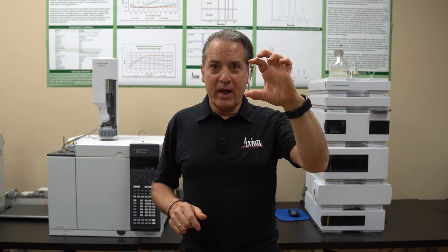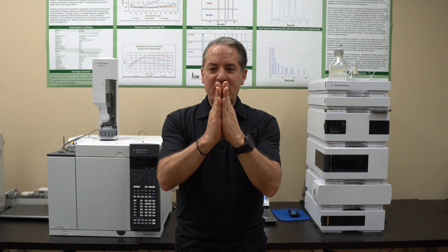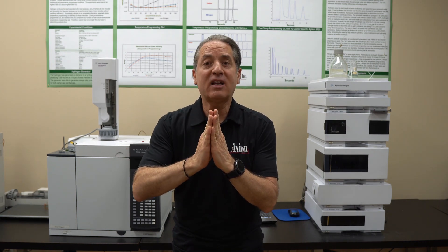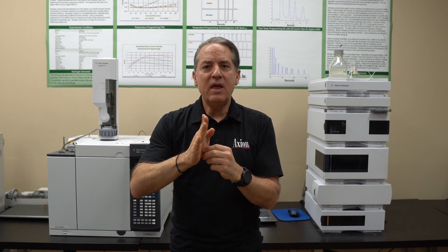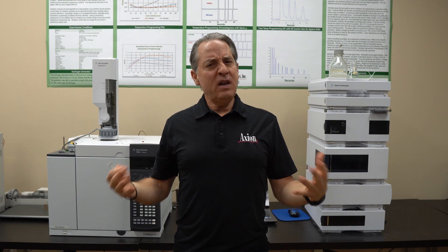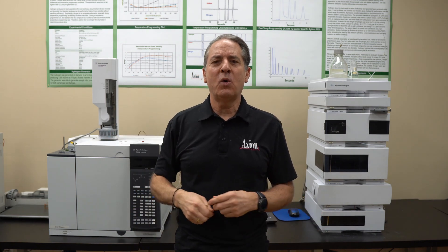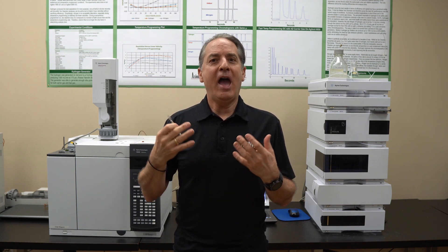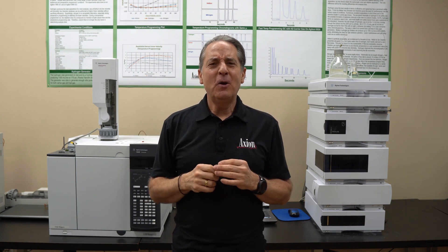The most important question is: how do I know my liner is dirty? We look at the peak shapes — peaks should be tall and skinny. If the peaks start to tail, especially for active compounds like acids, bases, and alcohols, then we know we have a dirty liner. If you see funny peaks, tailing peaks, or extra little blips in the baseline from noise, change the liner and the septum, and chances are those problems will go away.